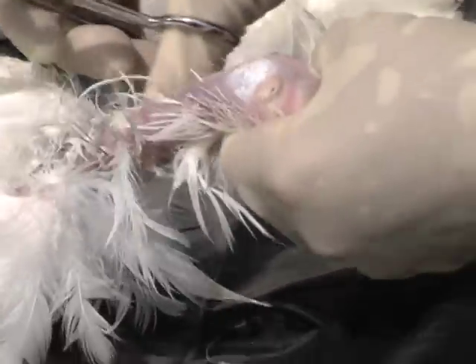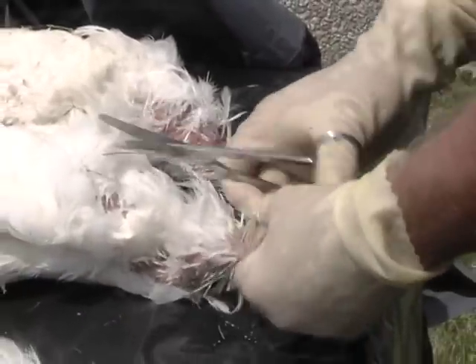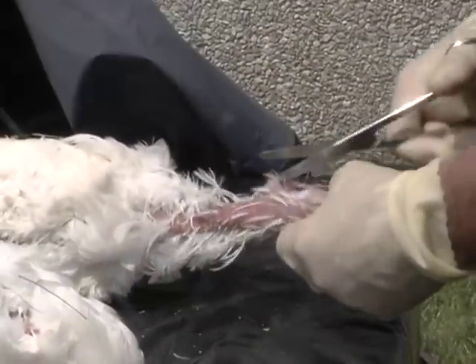Repeat the process on the rest of the chickens. Make a cut at the corner of the mouth, and then push your thumb down and stretch out the cut. The chickens are now ready to be swabbed.